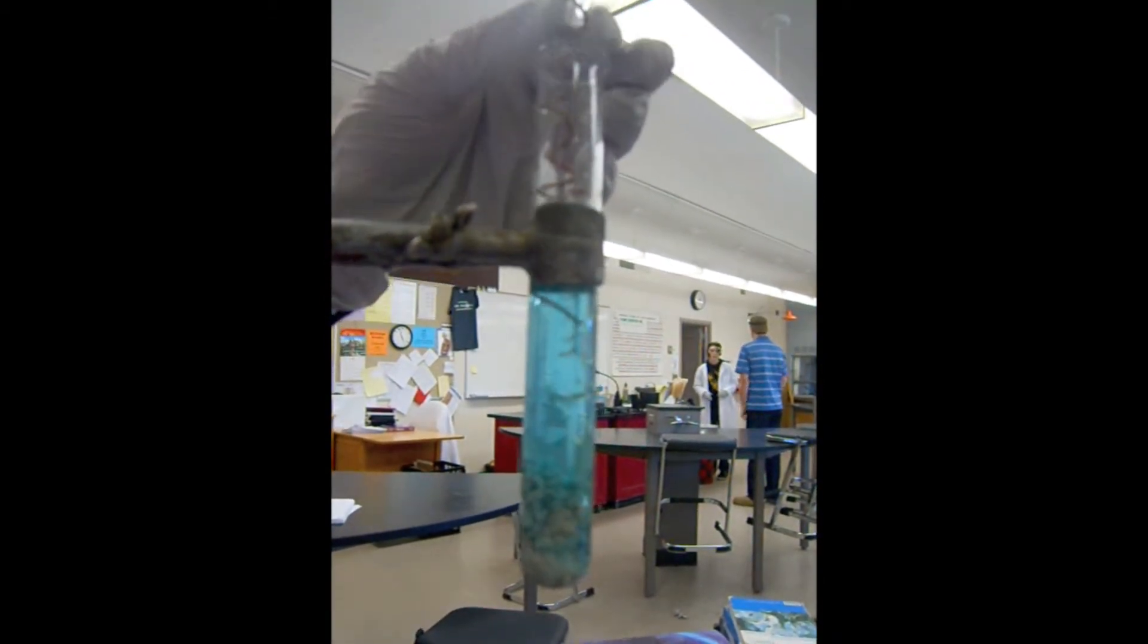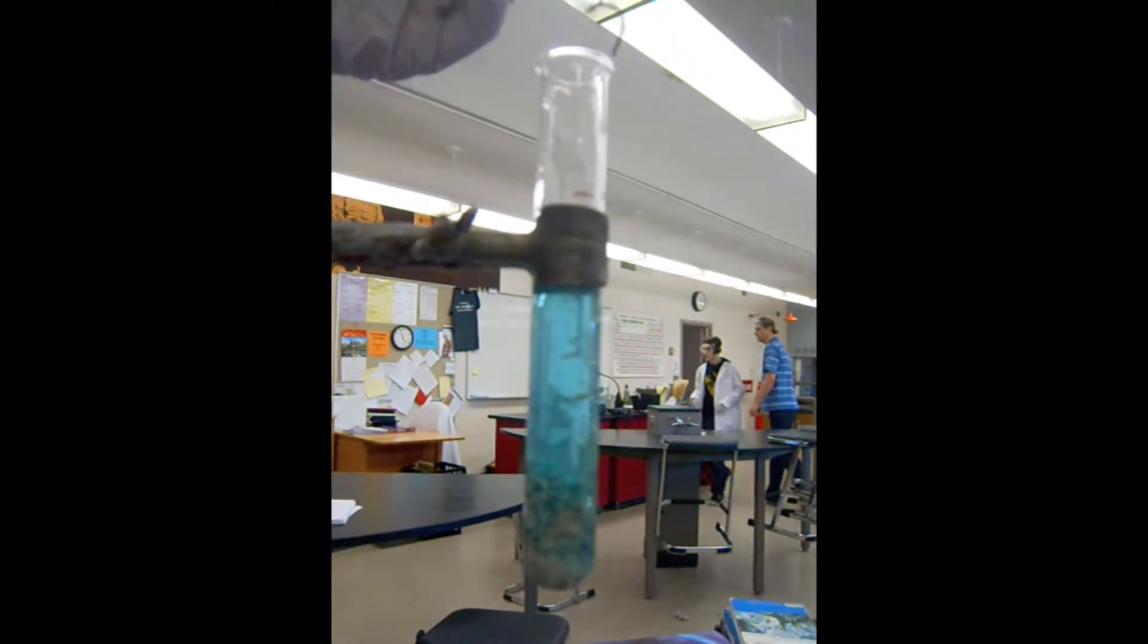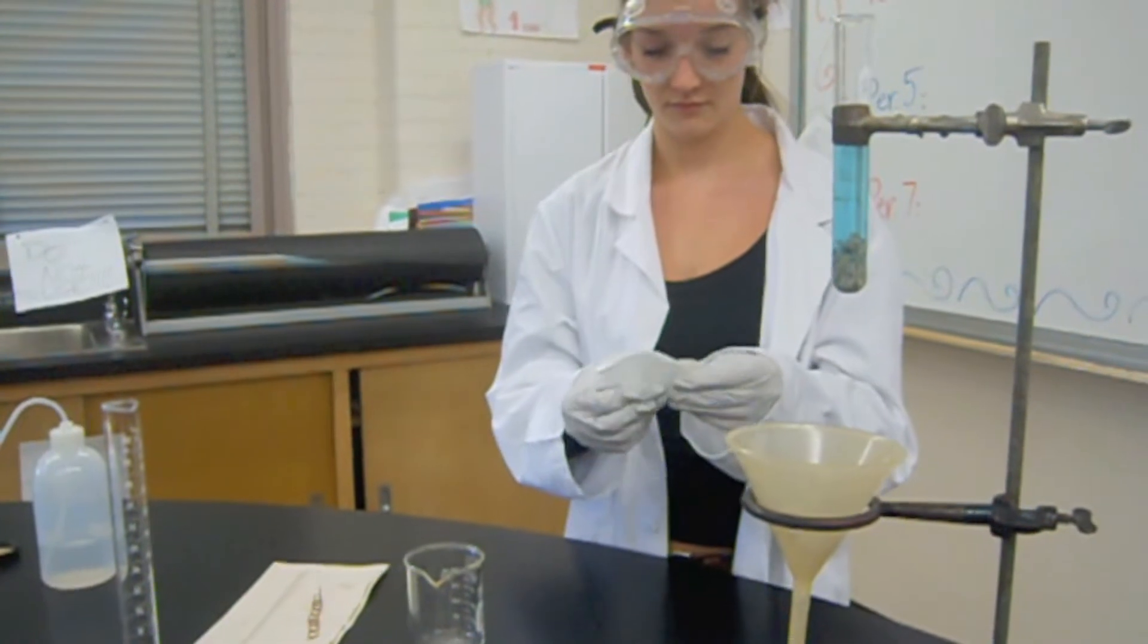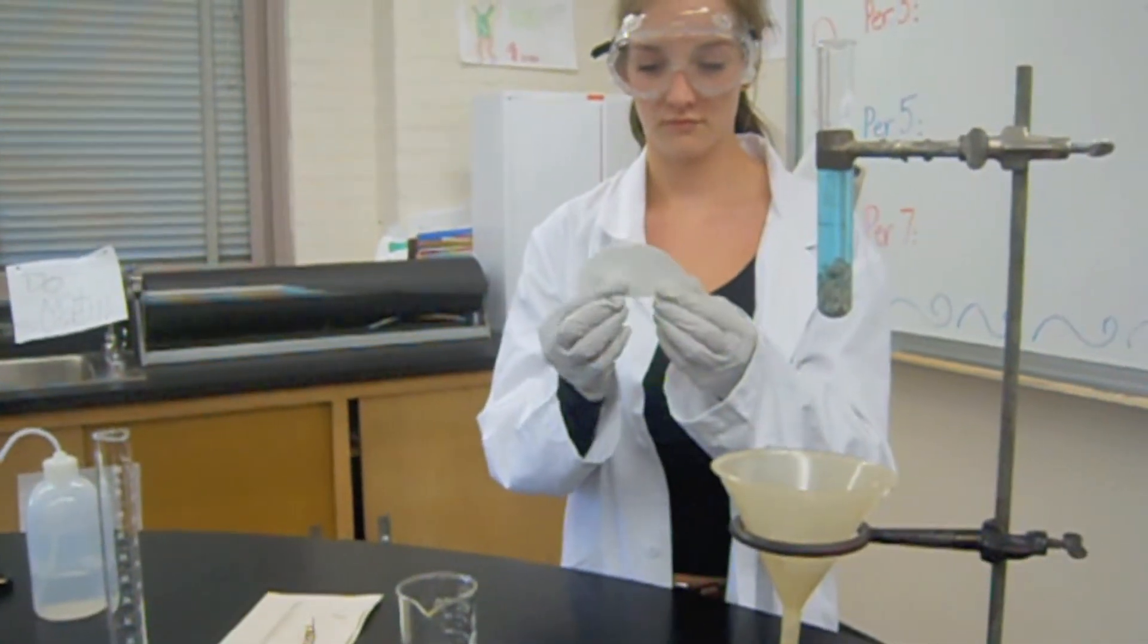Place the copper coil on a paper towel. Fold the filter paper in half, and then fold it in half again.